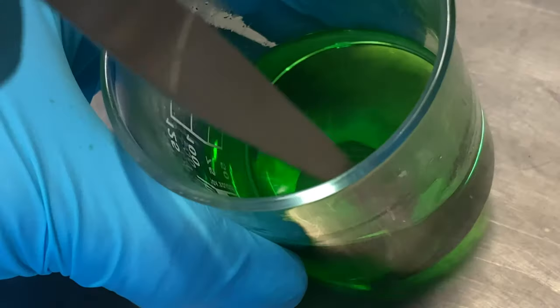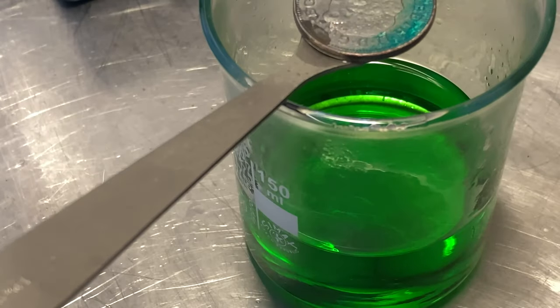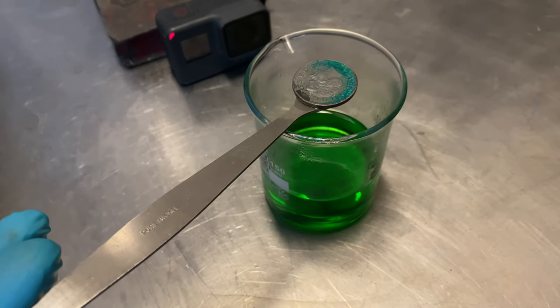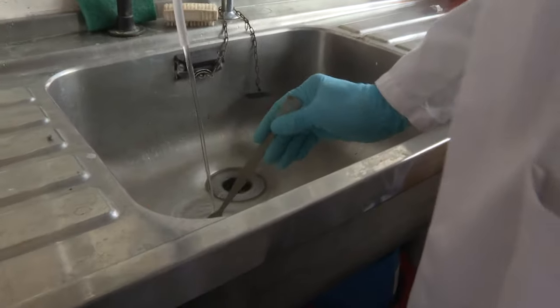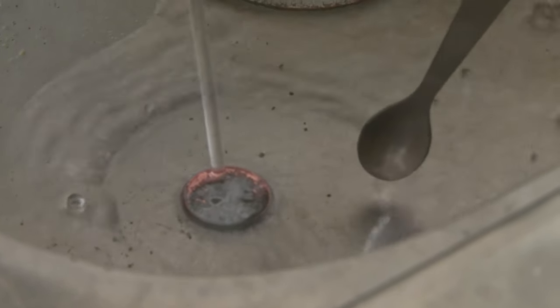While he waited, some of the solution of copper nitrate reacted with the iron and put some clean copper coating back onto the surface of the coin. There was the Iron Queen with a copper blotch next to her, which chemically is quite fun. But the thing which fascinated me, and of course Brady and Neil, was why on earth the first experiment had failed. Why did the Queen dissolve?